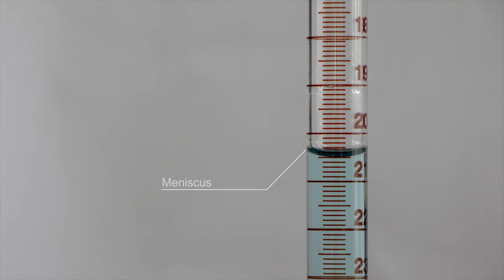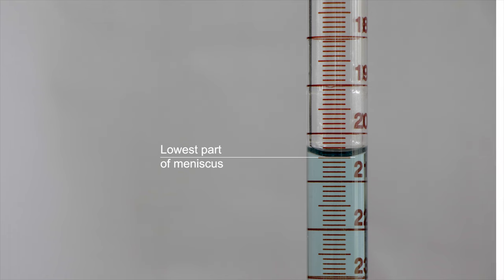The meniscus is the curved surface of a liquid and is essential in measuring the volume of solution in the burette, as the readings are determined by observing the position of the lowest part of the meniscus of the solution in relation to the graduations on the burette. This is done by the following.